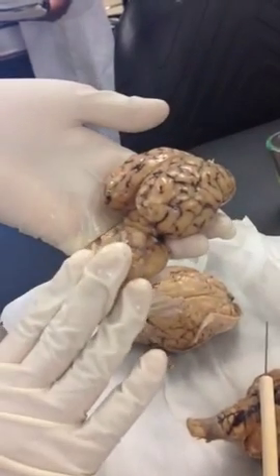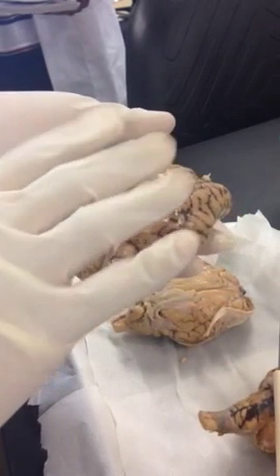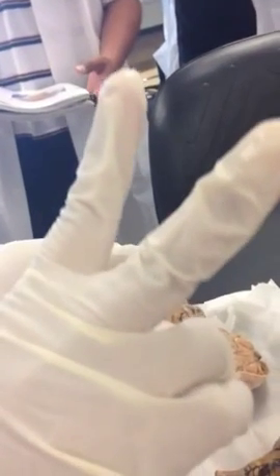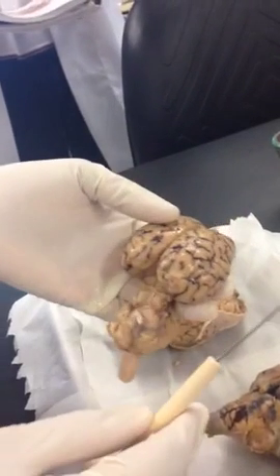So that tells you this is the anterior portion, this is the posterior portion of the brain. And so because you know that now, you can know that that's your right and the left. Because you always have to be specific whether it's right or left if you have two parts on both sides. So you have to tell whether it's my right or left, and so on and so forth.